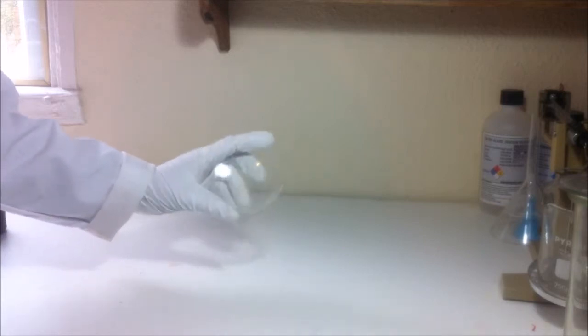Just another quick point - the thing you're doing it on, it's most likely going to get wrecked. So I'm doing it on a watch glass that's pretty dirty already, it's got iodine stains on it and everything so I don't really care if that gets wrecked. I mean you might be able to, it might survive but there's a high possibility that it won't.